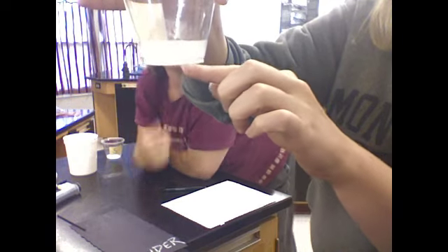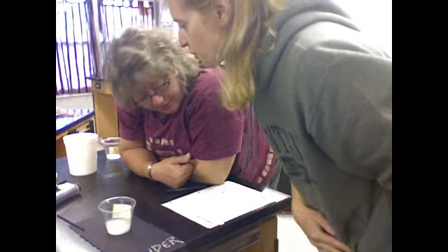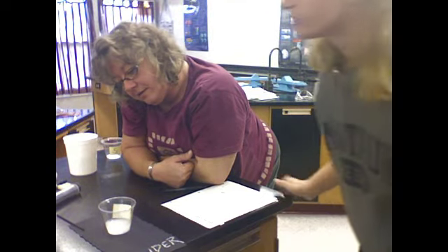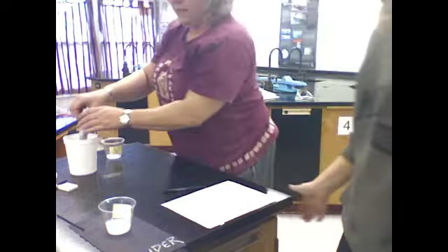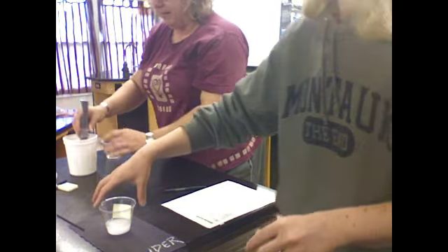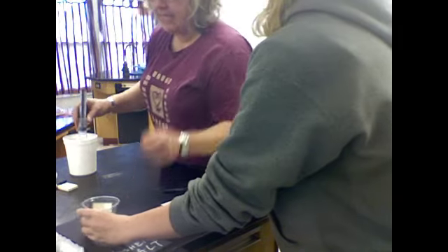I wonder if we let it sit for a while, do you think those other particles would settle back out? Well, why don't we add water to the salt and we'll go back to the powder and see if anything happens. Sometimes time is an important factor here. Sometimes things need a little bit of time to do anything different. Alright. So here comes the salt. 50 mLs of water.